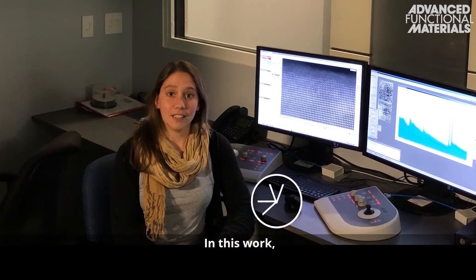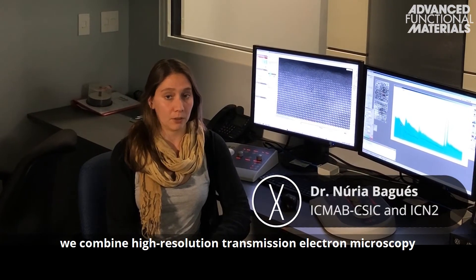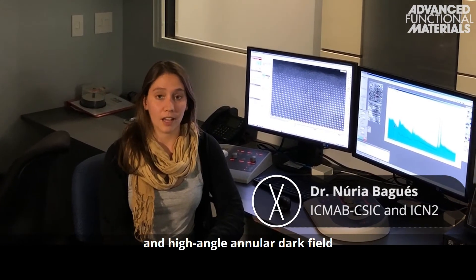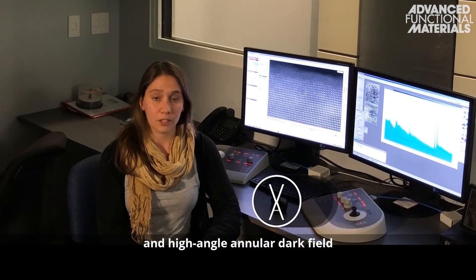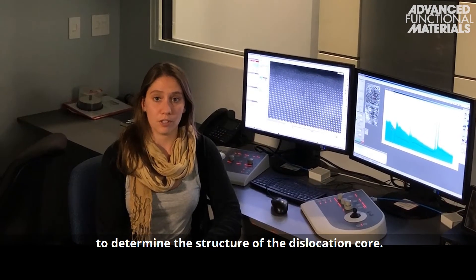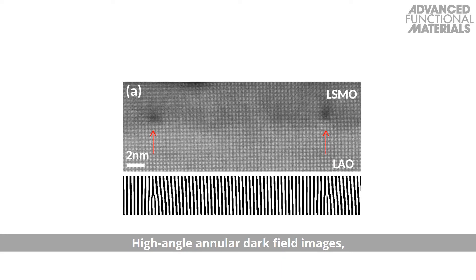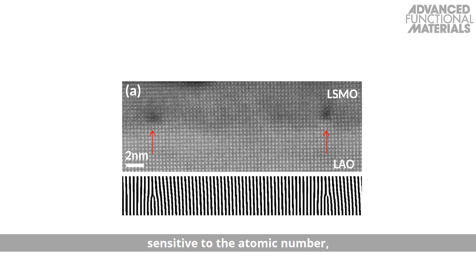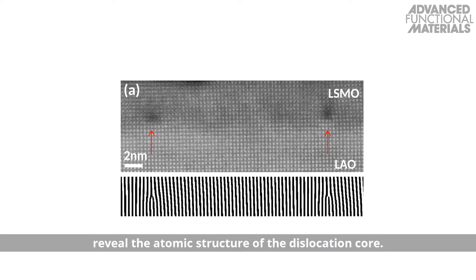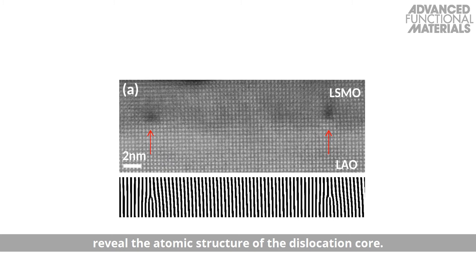In this work we combine high resolution transmission electron microscopy and high angle annular dark field to determine the structure of the dislocation core. High angle annular dark field images, sensitive to the atomic number, reveal the atomic structure of the dislocation core.